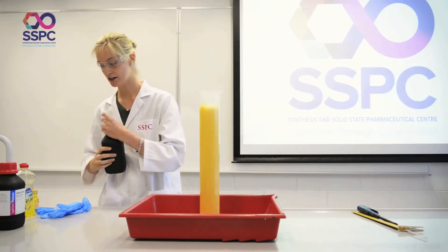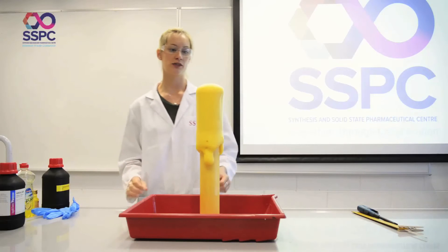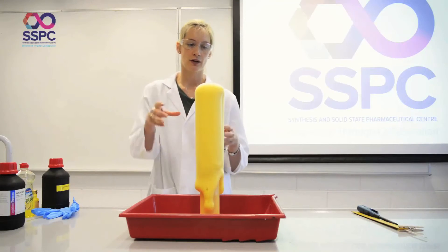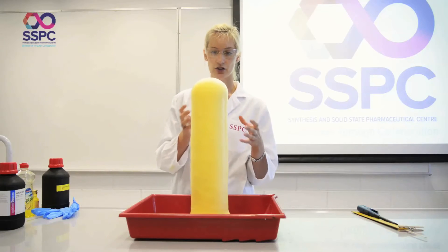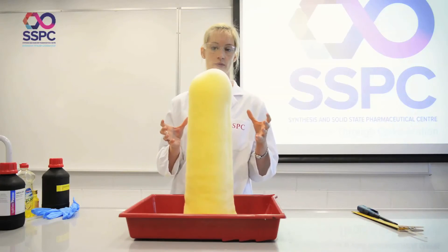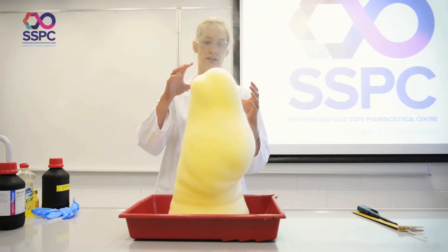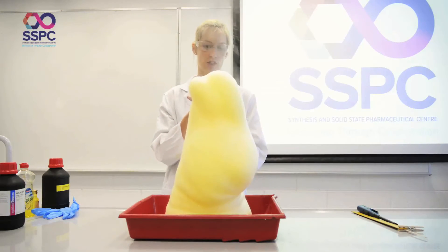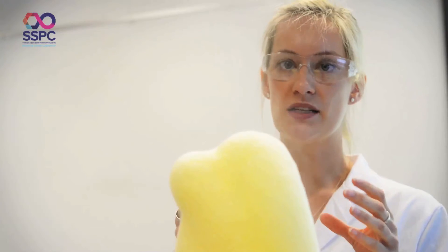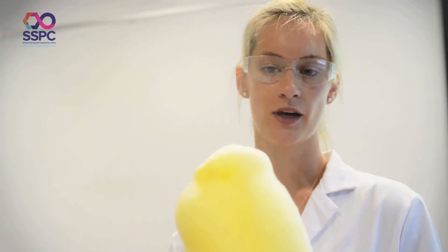We can see it takes place almost immediately and we have this characteristic colour which is given by iodine. Iodine isn't actually produced in the reaction but it will be an intermediate as the decomposition of hydrogen peroxide goes to completion.